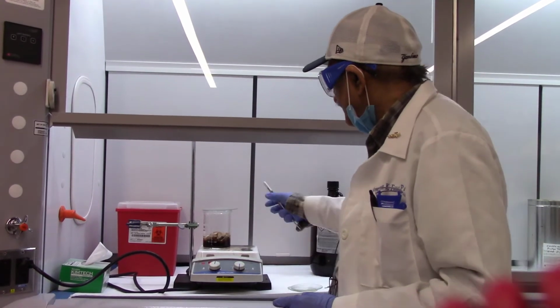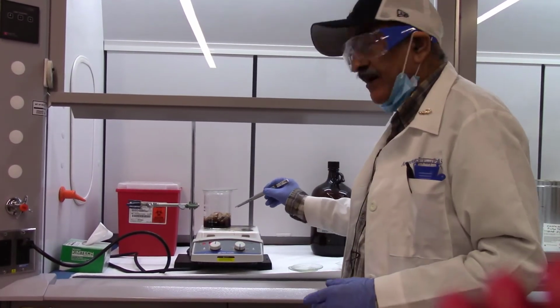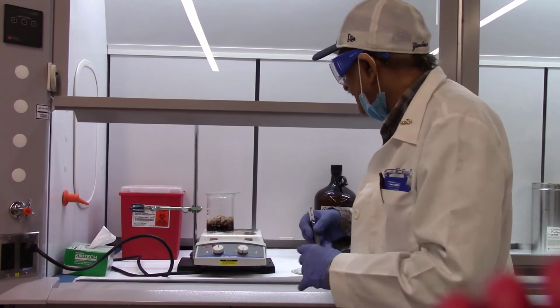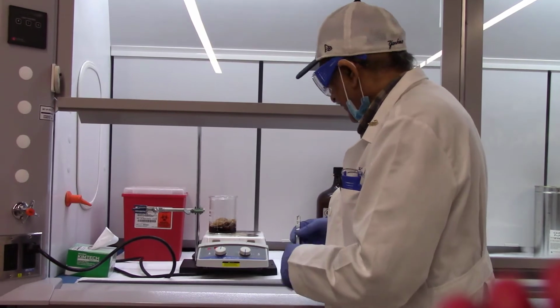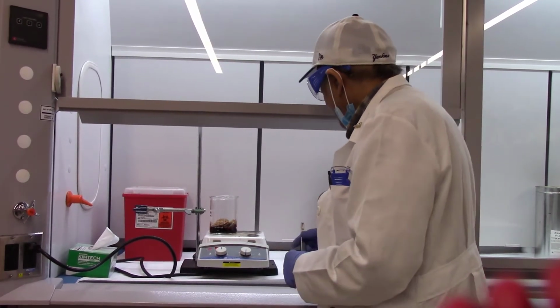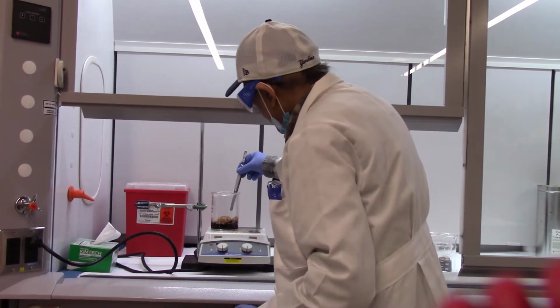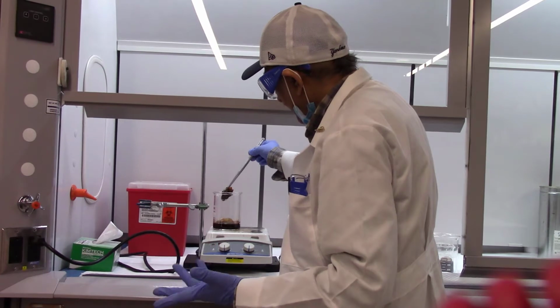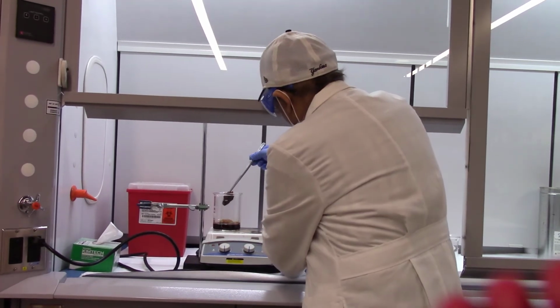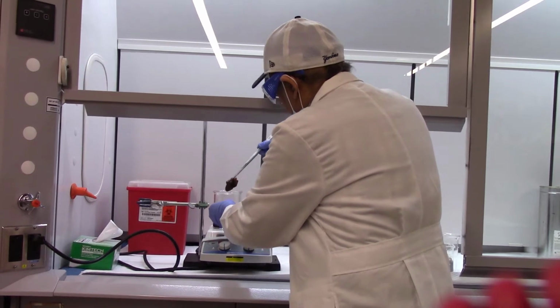All right, we have been boiling the three tea bags in water for about 15 minutes, and we assume that all the caffeine has been extracted from the tea bags. All we got to do now is remove the tea bags from the tea preparation. But before you do that, realize that all tea bags have quite a bit of caffeine in there too. So we want to extract those.